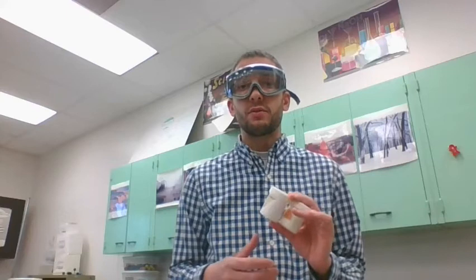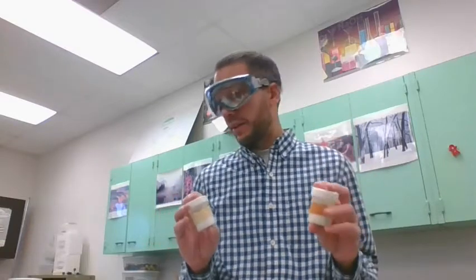So what's different about this lab is that we are going to calculate which one of these two runs out first. One of them is going to run out, and then the amount of PbI2 is going to stop. It's not going to be obvious this time like it was in the other lab, when the blue stuff was gone but the nail was still there. These are both white solids.